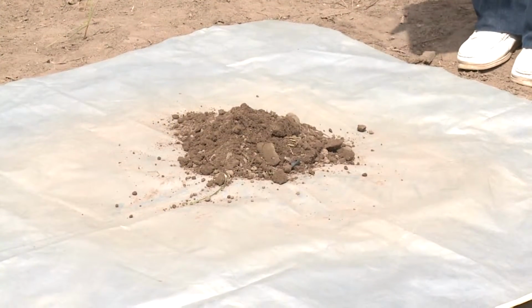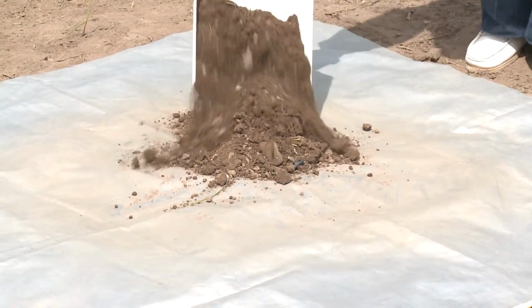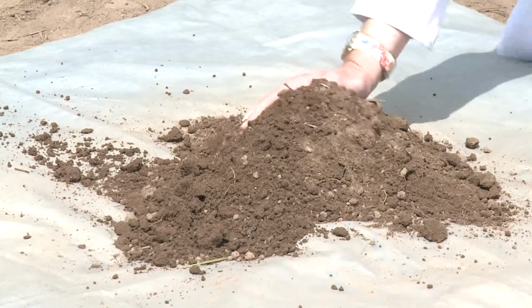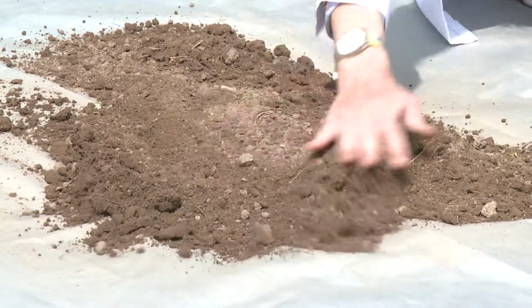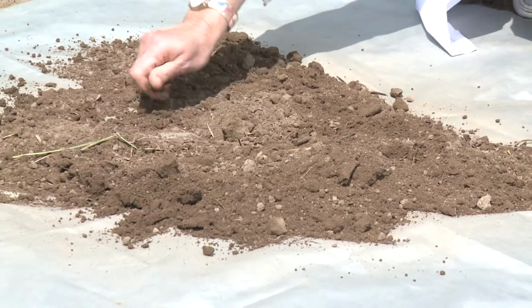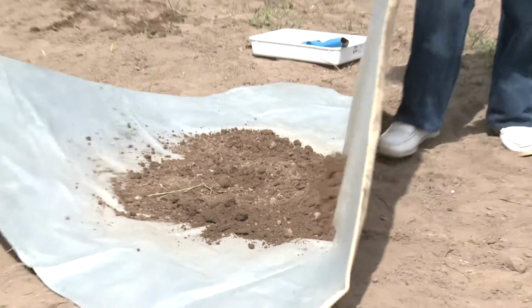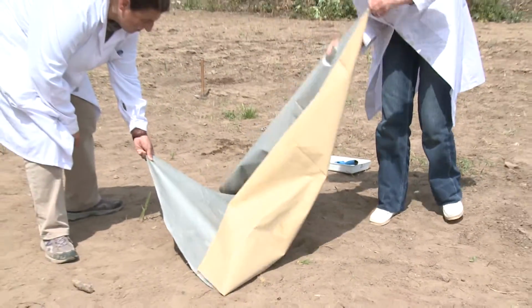If after mixing all the soil samples the amount collected is still too large to be transported to the laboratory, we should then repeat the procedure and select a smaller subsample by quartering. All the samples should be put on a canvas sheet, mixing well the soil.